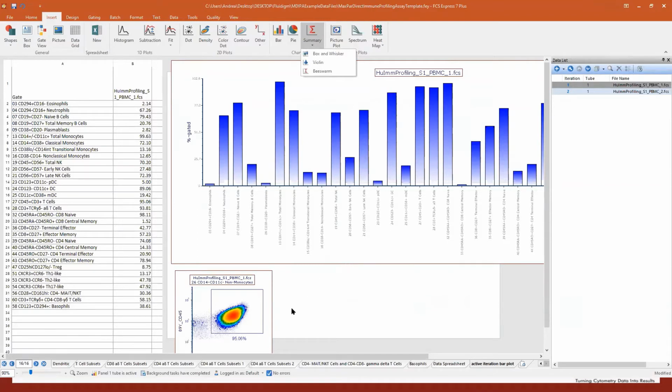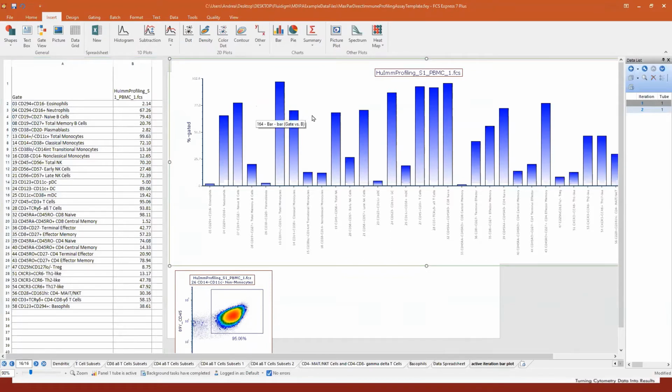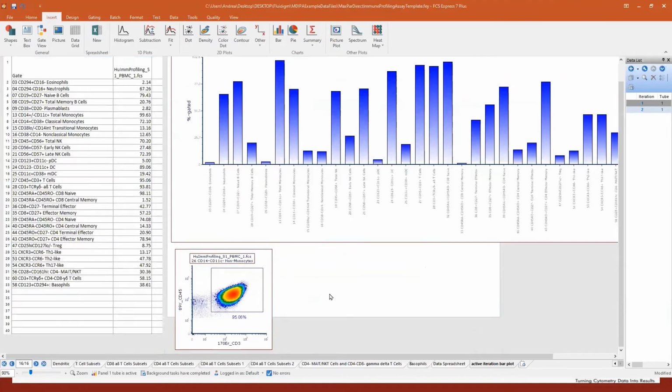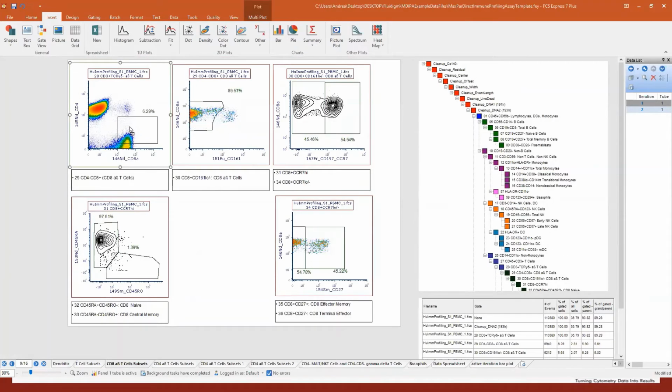I want to show you that in FCS Express, everything is live updating. What you see on the screen now is a bar plot depicting a sort of summary. I have a bunch of populations of interest with all the statistics, and what I've done was to graph those statistics, those percentages, in a bar. And as you can see here, I have a plot. This plot can be in another page, or it can be in this page. It doesn't matter. This plot is a gate on CD3. As soon as I adjust this gate, you will see that a few bars will update in real time. Those bars that update in real time are all the T cell populations. So in FCS Express, you have live updating capability inside the software. This is true also, let me go back to the CD8. If I move this, you can see that every other plot, and also in every other page, updates live.